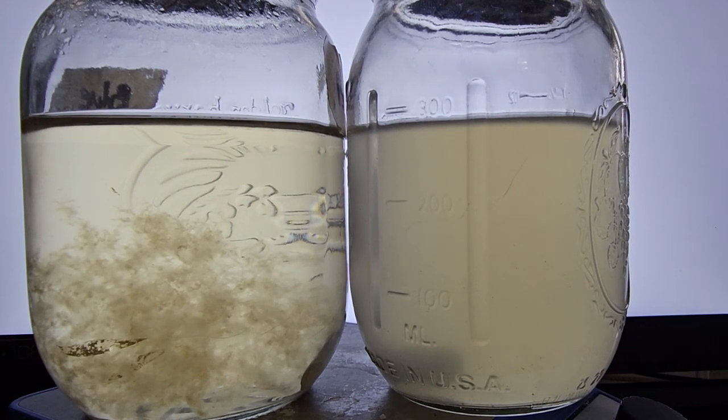Want to talk today about liquid culture jars, and specifically healthy jars and not healthy jars. So here I have a real good example of a really healthy jar on the left, and a very obvious example of something that just isn't working on the right. You can see the one on the left, super clear, no contamination. The one on the right, it's possible that it had a contamination, but what I actually think it is, and this experiment kind of confirmed, is overcooking of your liquid culture.